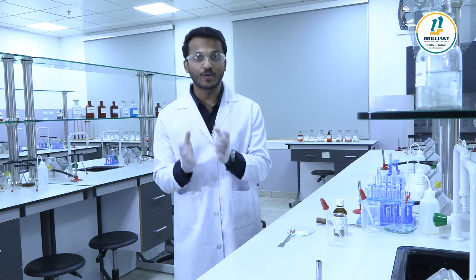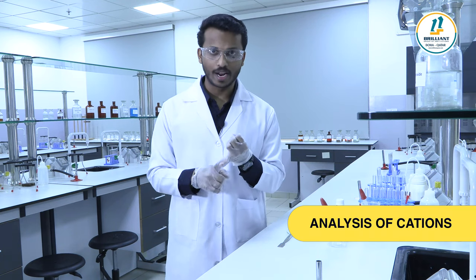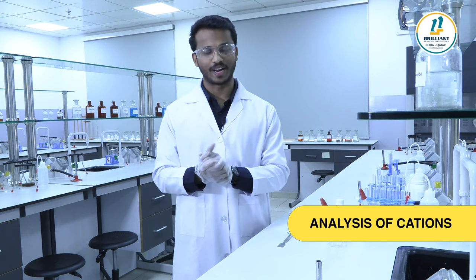After completing anion analysis, we have to start the cation analysis. We already identified some anions: chloride, sulfate, nitrate, carbonate, and acetate. Right now we are going for the cation analysis.